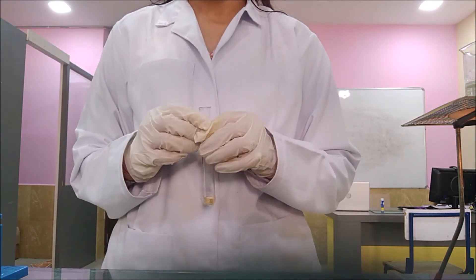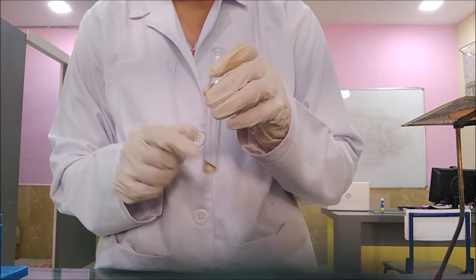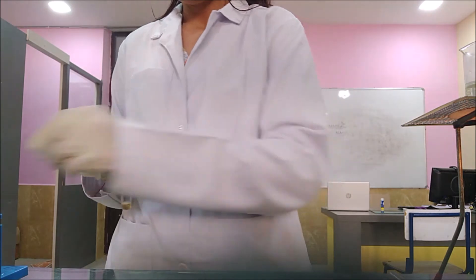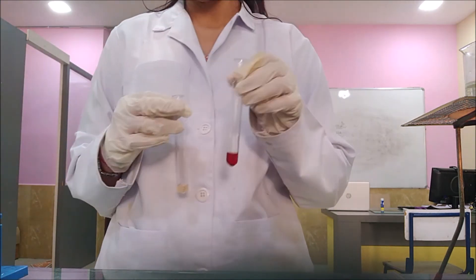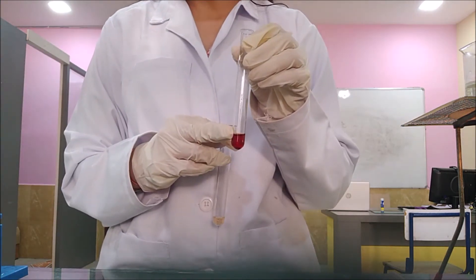Take around 1 ml of organic compound. Then you have to take Sodium Nitroprusside in a test tube.